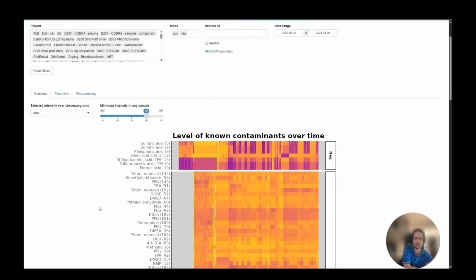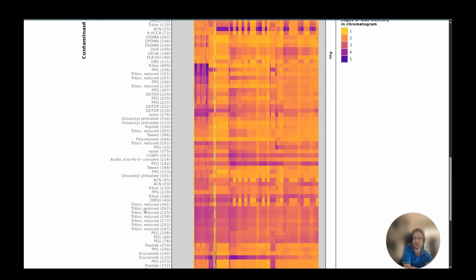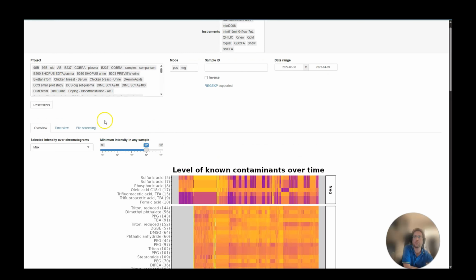In the heat map, each row is a known contaminant, and the colors show the intensity. And on the x-axis, you have time. For example, you can see here that erucamide suddenly stands out and then goes away. Let's investigate that more by going to the Time View tab.